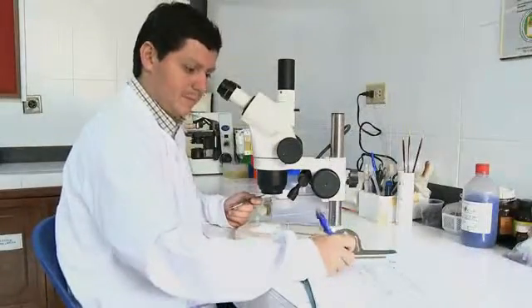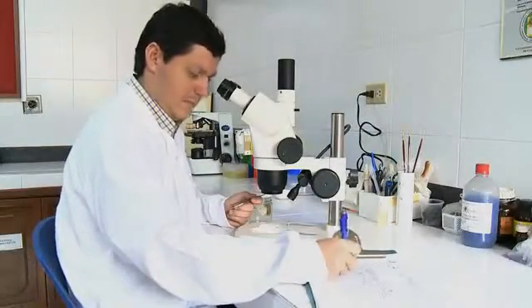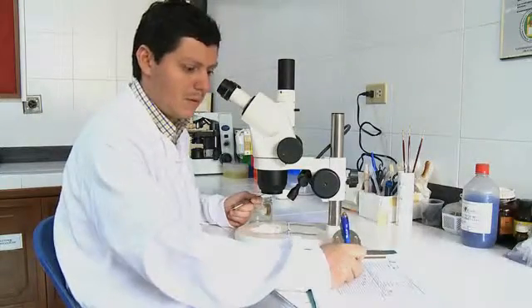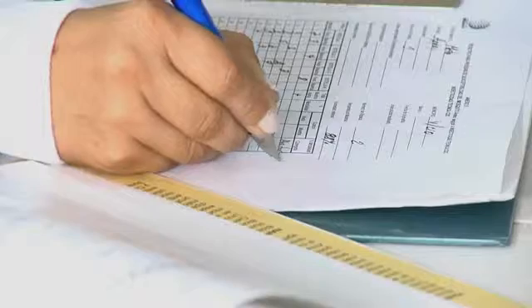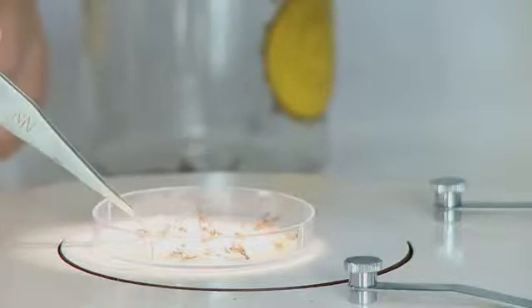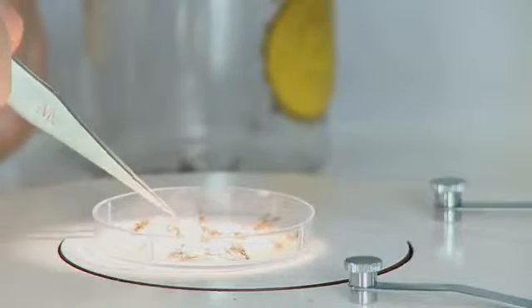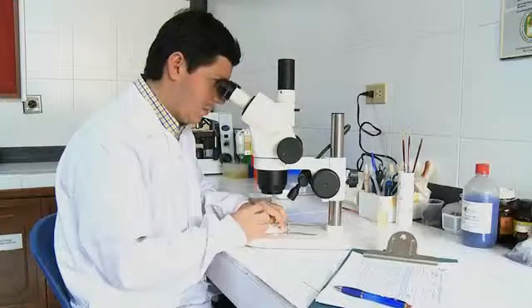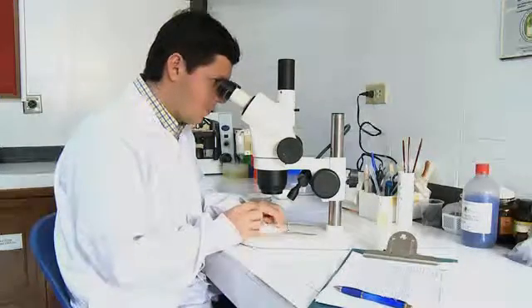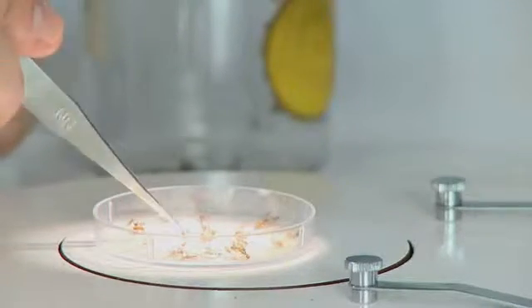Once this is done, it is necessary to use biochemical and molecular testing to confirm the mechanisms of resistance in order to establish a resistance management strategy. Biochemical and molecular testing can be done at a reference laboratory. As a precaution, the WHO recommends that a resistance management strategy is included in any insecticide-based vector control from the beginning.